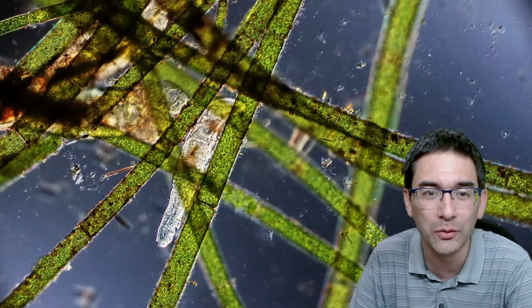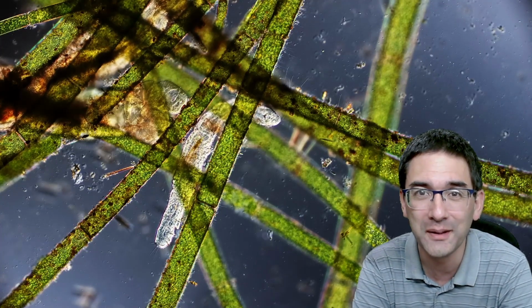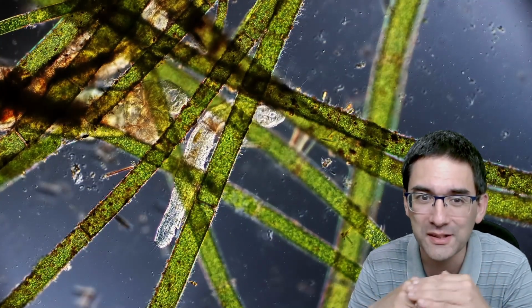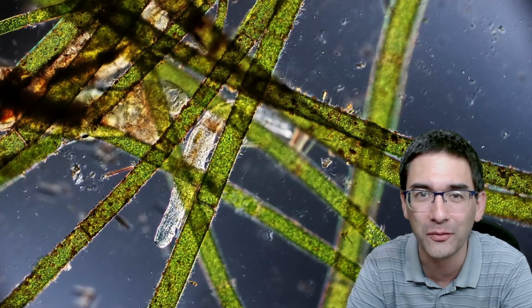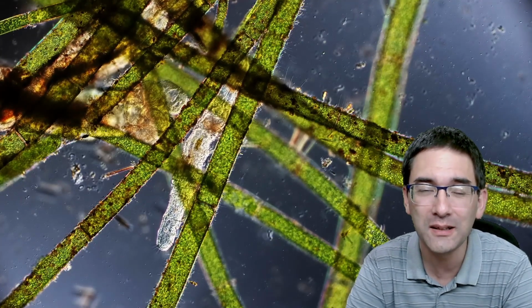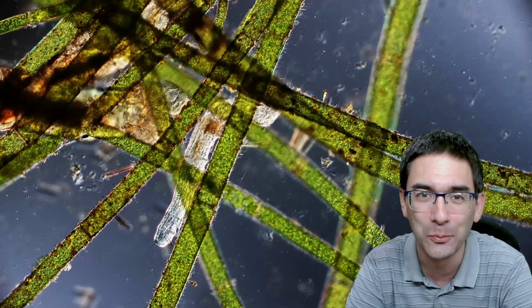And then the last one over here, I did find a little worm as well. It got stuck between the algae here, again because of the cover glass and the microscope slide. It was compressed a little bit, so it was inhibited in its movement, and sometimes that's quite convenient, because otherwise they move out of the way so quickly, and then it's difficult to observe them. So basically I just wanted to show you a couple of things that I found. I think I'm just going to leave it at that. Hope that you liked the video.